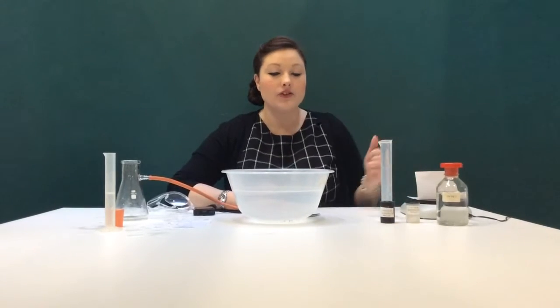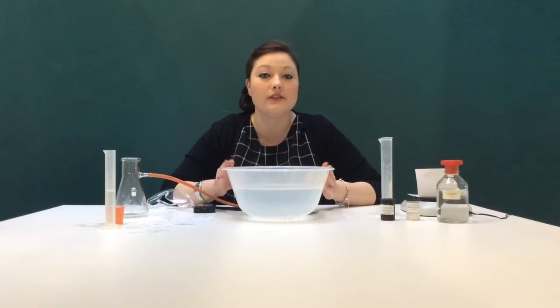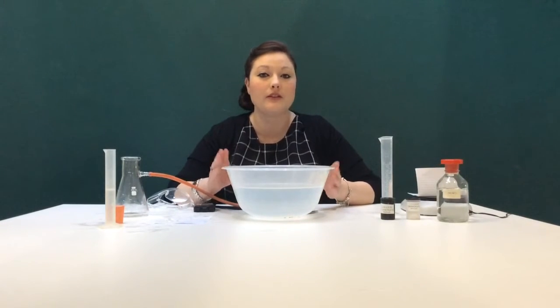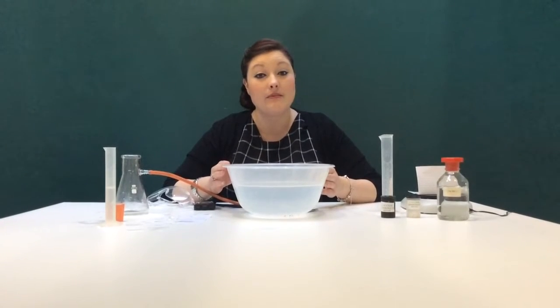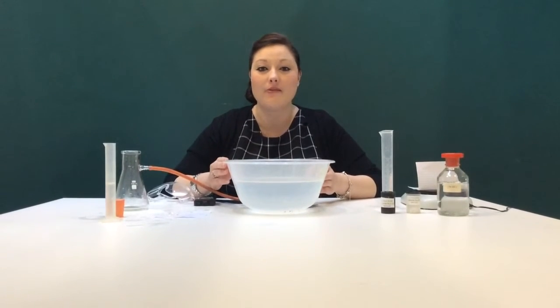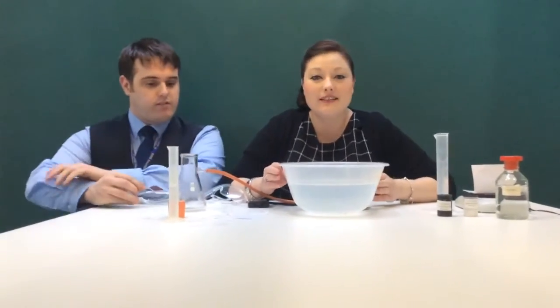Okay, so we need to set up our equipment, and this is going to involve quite a lot of teamwork. You're not going to be able to do this on your own. So for today and for my team, I've got Mr. Guest to come and help me. Thank you, Mr. Guest.